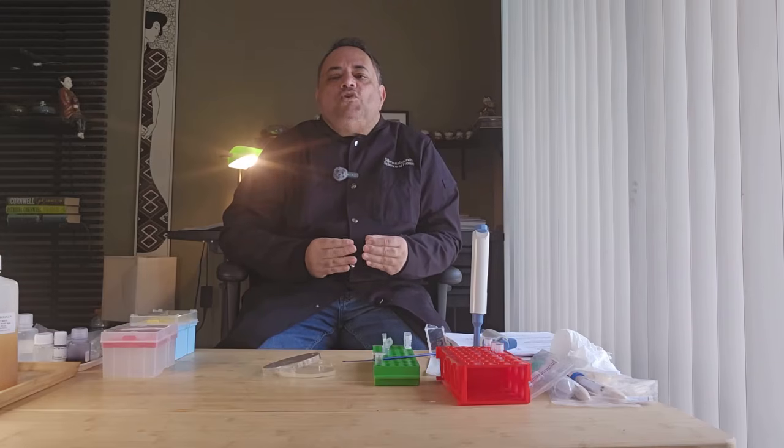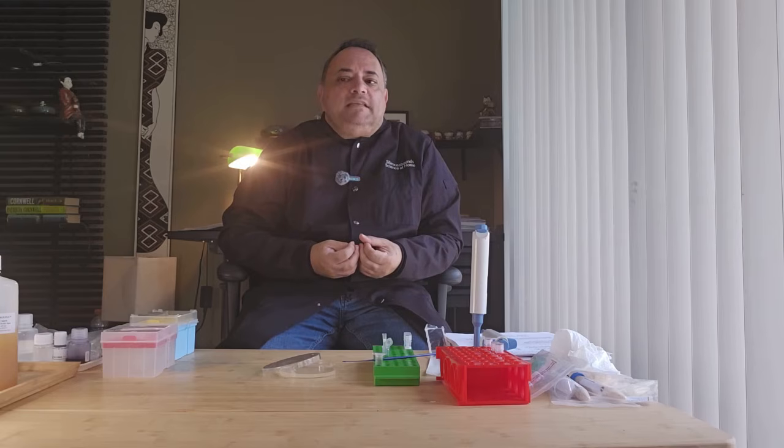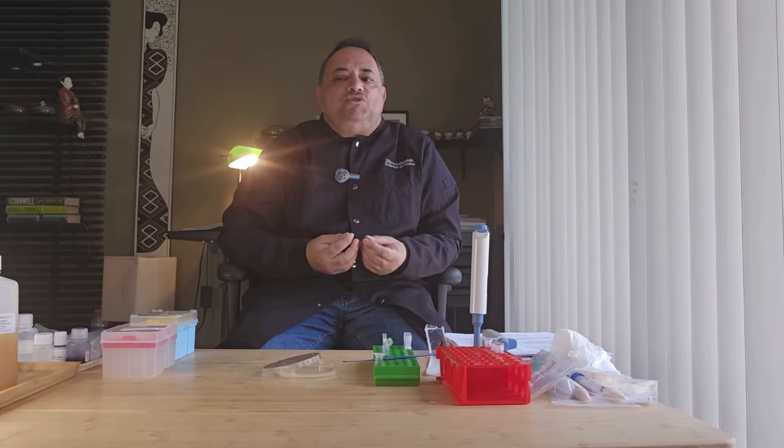Normally, E. coli will not grow on media containing streptomycin. Streptomycin binds to the ribosome and prevents it from making proteins, stopping the bacteria from replicating and growing. We will make a specific mutation in the ribosomal subunit protein that prevents streptomycin from binding it, allowing the bacteria to grow on the streptomycin media.